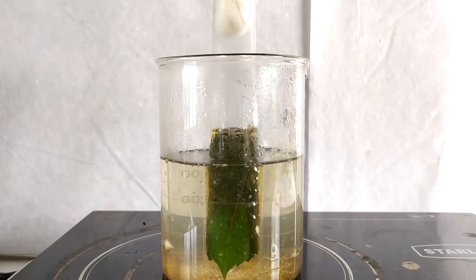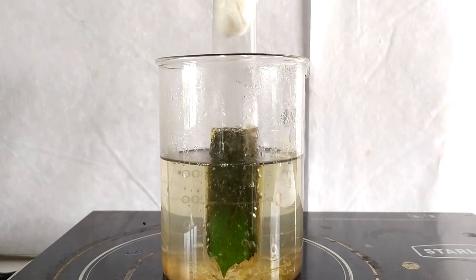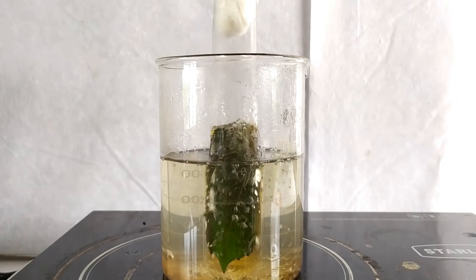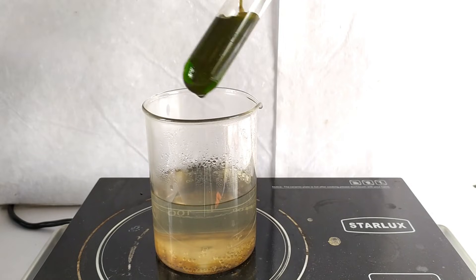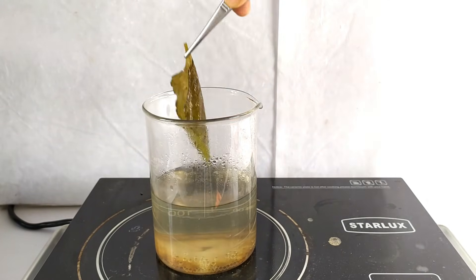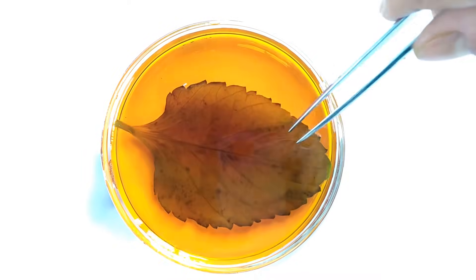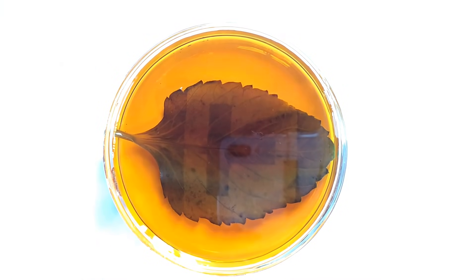During this boiling step, chlorophyll pigments in the leaf are decolorized by the hot alcohol solution, resulting in a bleached leaf with a pale white color. This step is necessary for better visualization of the iodine starch reaction on the leaf surface later in the experiment. Once bleaching of the leaf has been accomplished, remove the leaf from the alcohol using forceps. Briefly place the leaf in the hot water bath for a few seconds to soften it, then transfer the leaf to a petri dish containing iodine solution. After a couple of minutes, you will see that the exposed parts of the leaf not covered by the black paper turn blue-black in color in the iodine solution.